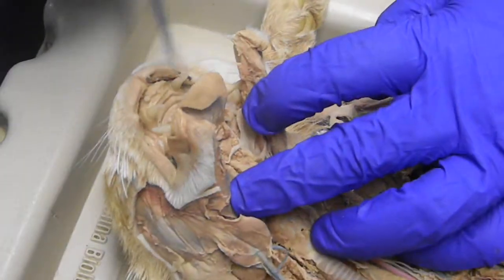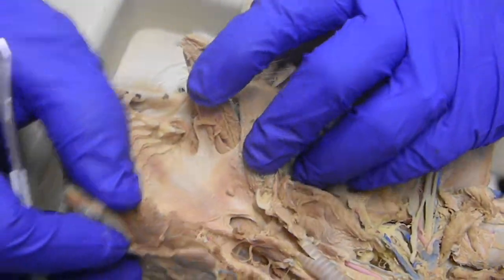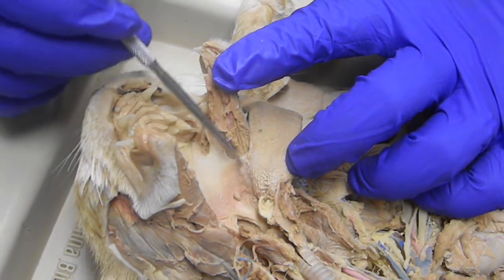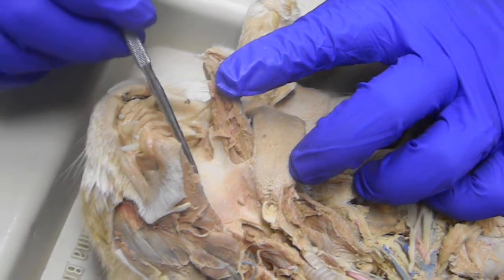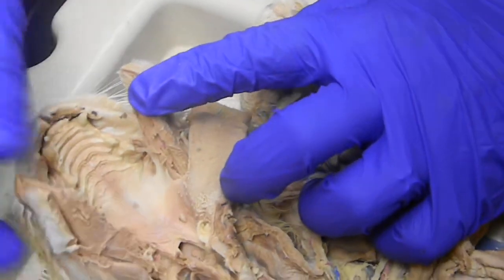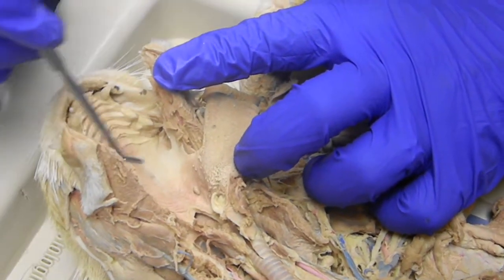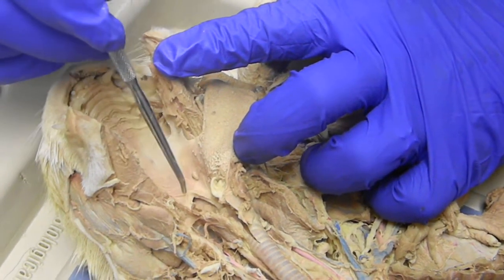We're going to open up the oral cavity. We're rotating the tongue out. Where the tongue is attached to the soft palate right here, this tissue right here is the palatal glossal arch. This is the soft palate, and that's the hard palate. From that palatal glossal arch forward, this open area here is the oral cavity. This open area behind it is the oropharynx.